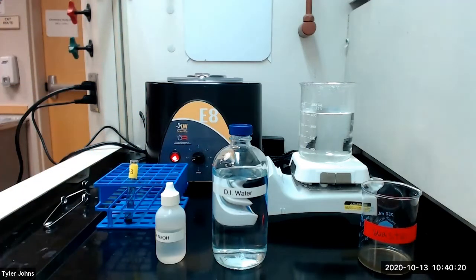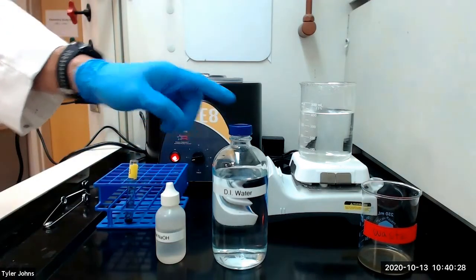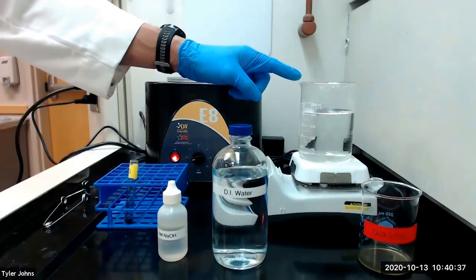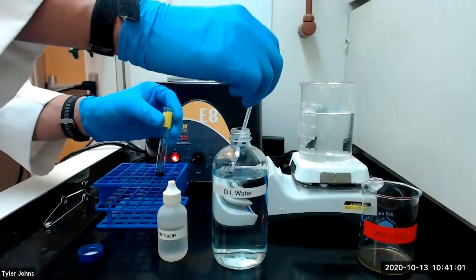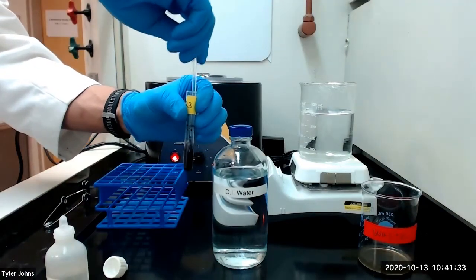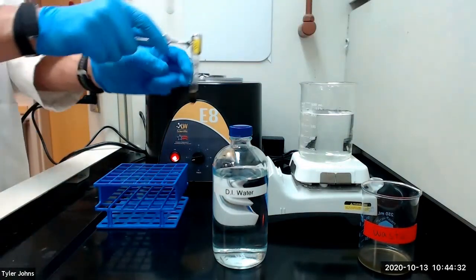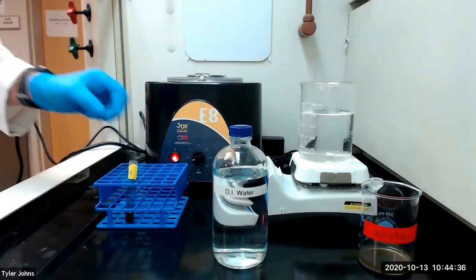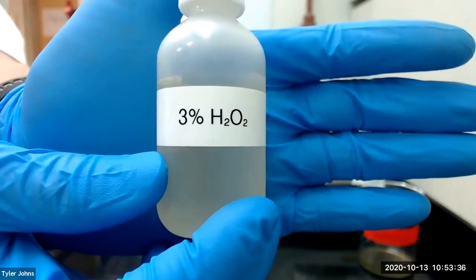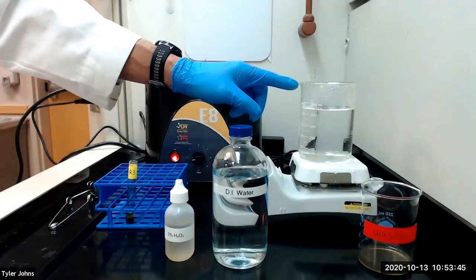We will now begin the separation of the copper and tin subgroups. To residue R3 we're going to add 1 milliliter of deionized water and 5 drops of 6 molar sodium hydroxide. We will stir well and then warm in a water bath for 2 to 3 minutes. After warming, remove the test tube from the warm water bath and allow it to cool. Then add 5 drops of 3% hydrogen peroxide to oxidize any tin 2 ion to the tin 4 state.